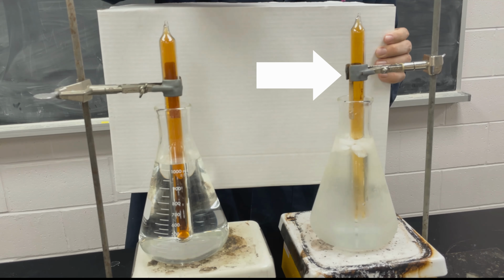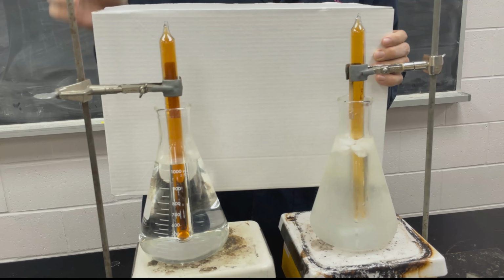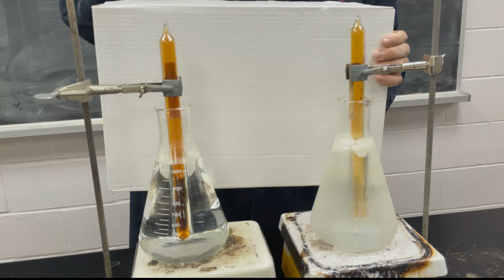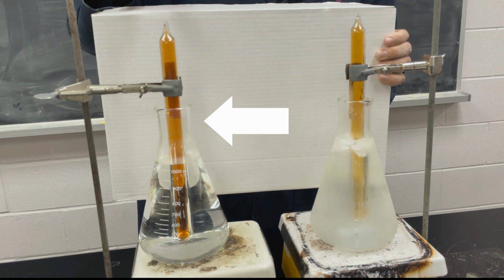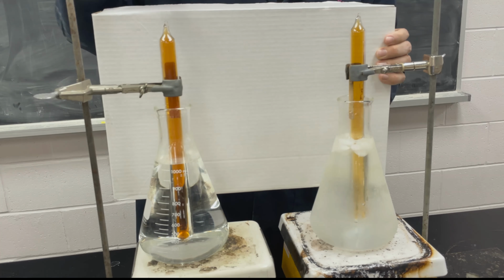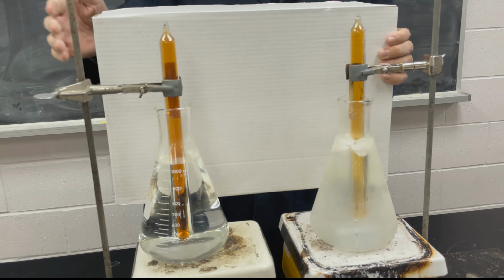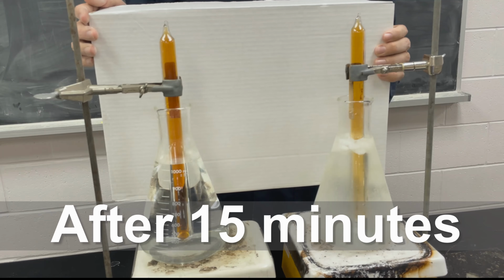So here we can see at lower temperatures, the equilibrium shifts towards the colorless N2O4, which has fewer gas molecules. And over here at higher temperature, the equilibrium shifts back towards the reddish-brown NO2 gas. This is actually often seen in smog, which is the brown haze in urban areas that is more prevalent on warm, sunny days.